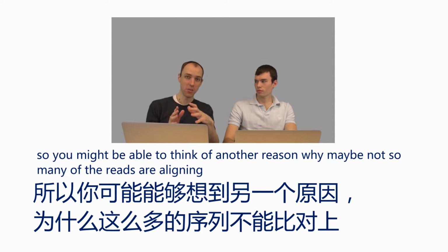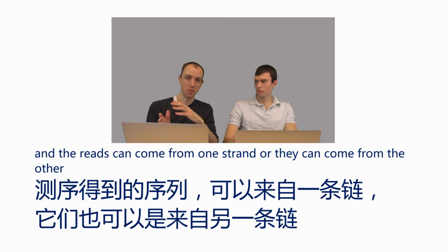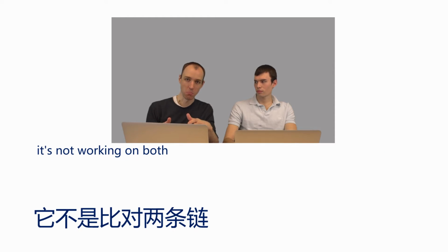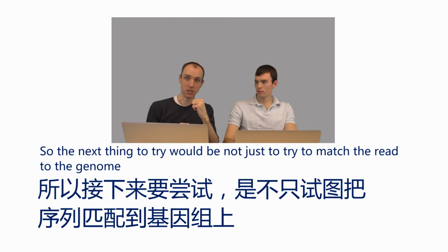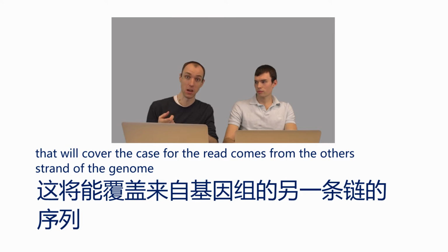So you might be able to think of another reason why maybe not so many of the reads are aligning. In this case, it's because the genome is double-stranded, and the reads can come from one strand or they can come from the other. But the exact matching problem we've set up is only looking on one of those two strands. It's not looking on both. So that could explain in large part why we're seeing less than half of the reads actually matching back to the genome. So the next thing to try would be not just to try to match the read to the genome, but also to try to match the reverse complement of the read to the genome. That will cover the case where the read comes from the other strand of the genome.